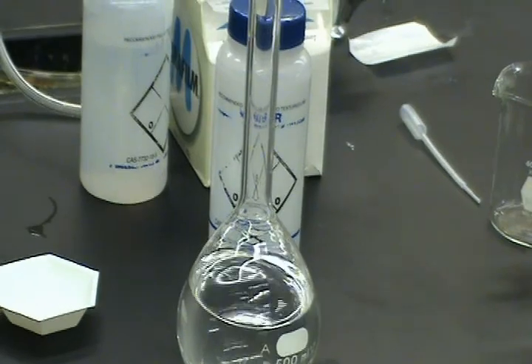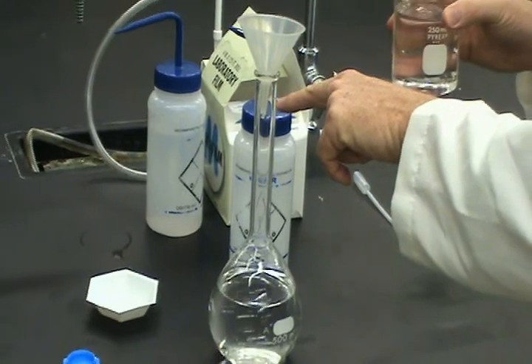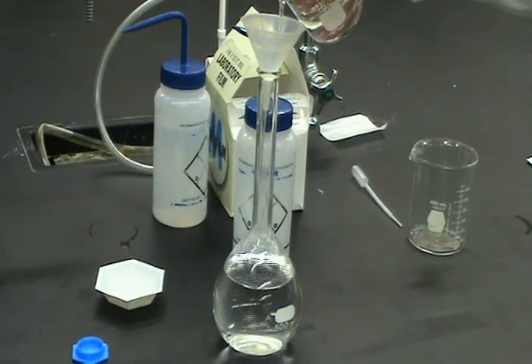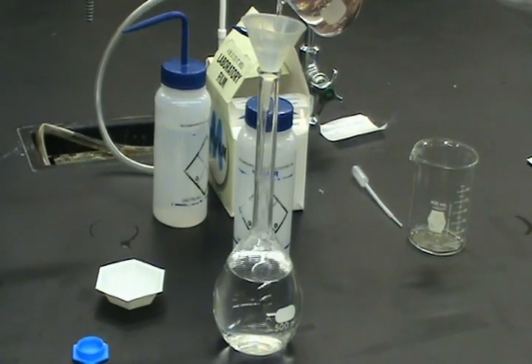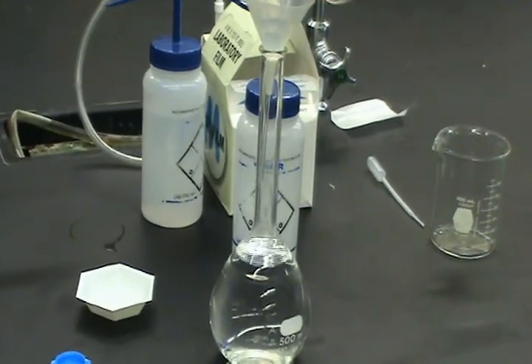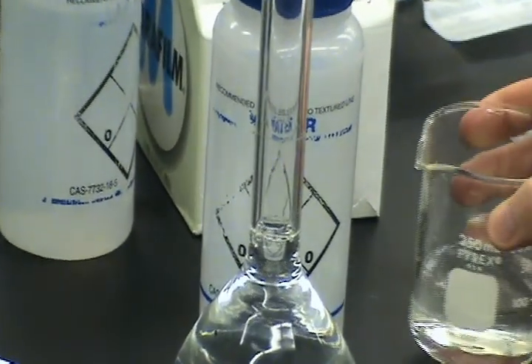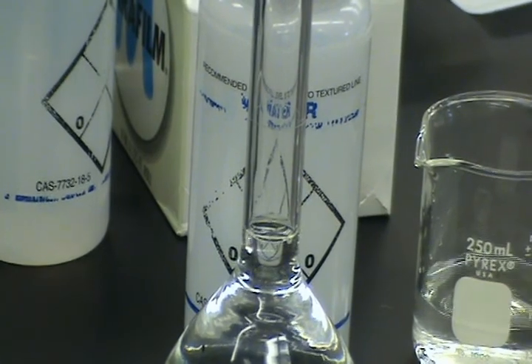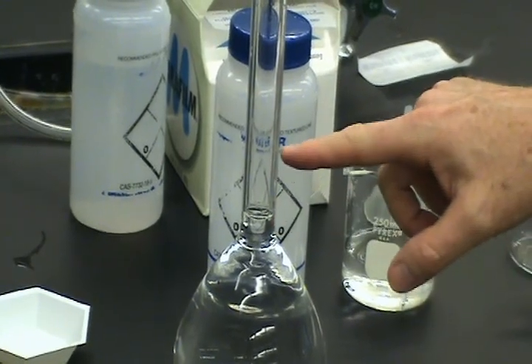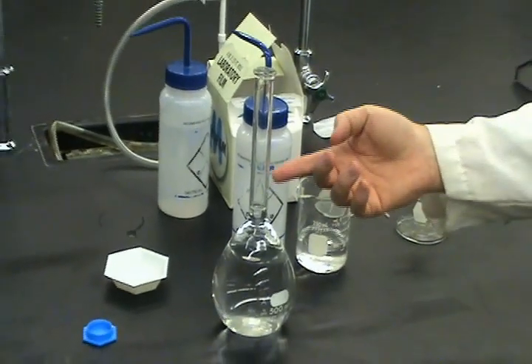Here it is when I'm using the funnel. Be careful with the funnel because that spout is very narrow, so things kind of build up in the head of the funnel. So I'm just continually adding the water. I'm adding the water slowly. Slowly, slowly, slowly. Okay. This is where it becomes very important. Take out the funnel. Notice, here is where the watermark is. I have to get up to here. I do not want to use this because I will overshoot and the solution will be ruined.